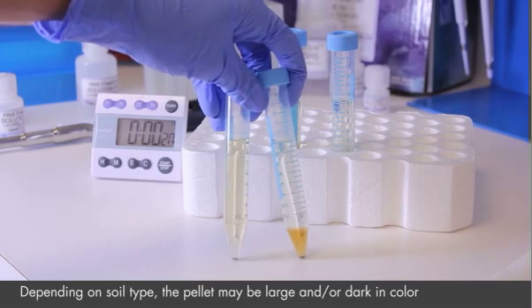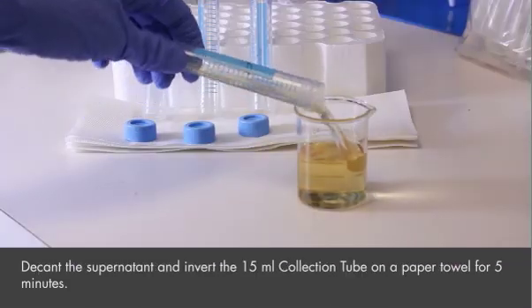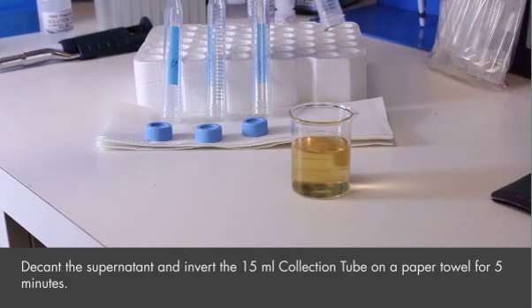The supernatant may look different depending on your sample. Discard supernatant and invert the 15 ml collection tube on a paper towel for 5 minutes.